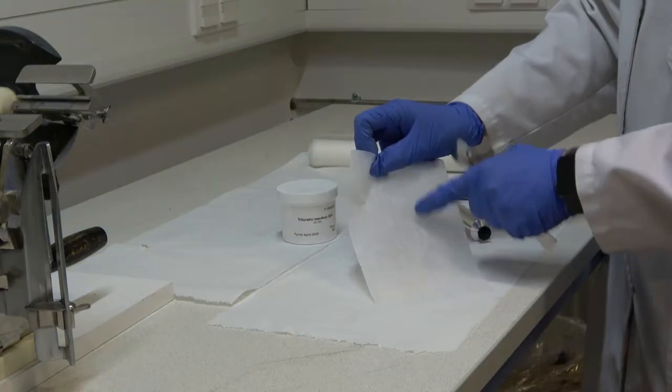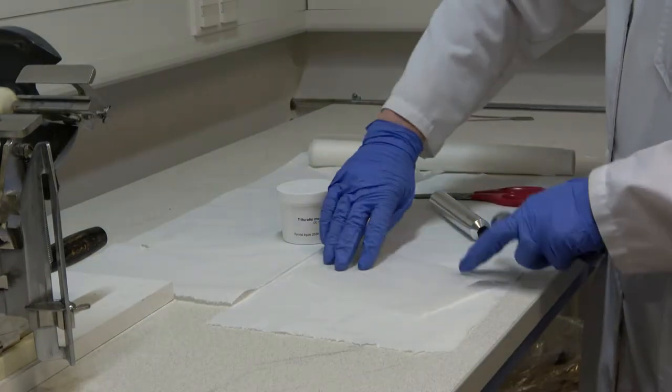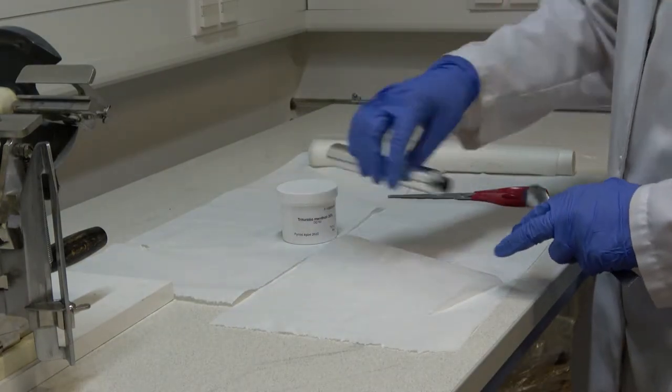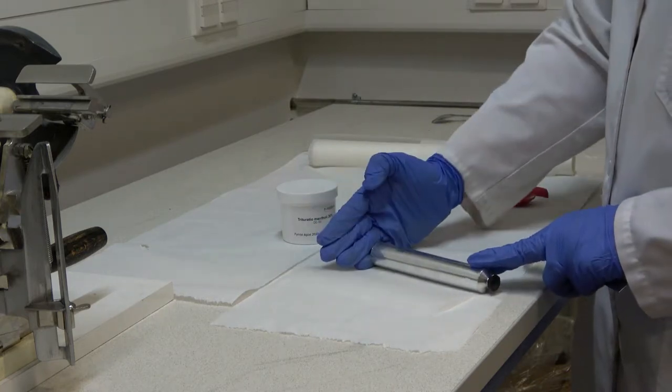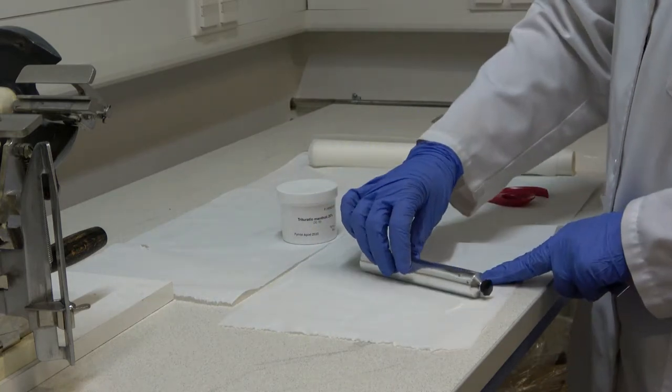It's important to weigh the paper before the formulation is placed on it, and the tube sleeve is weighed as well, so that a correct value can be obtained concerning the amount of product within the tube.